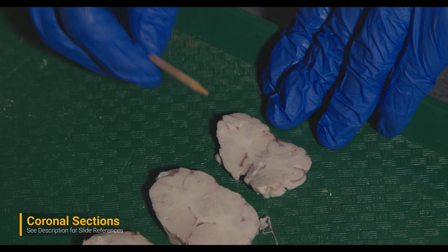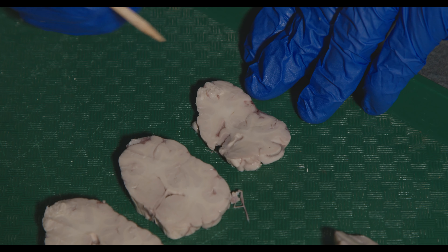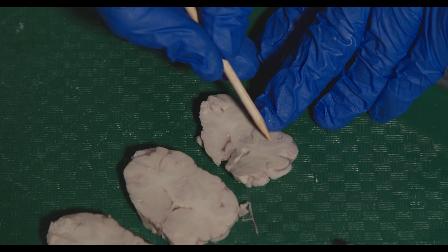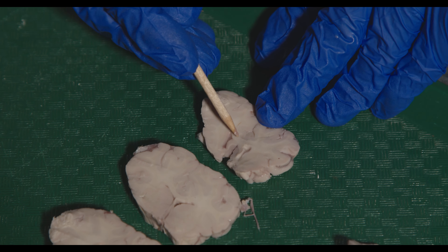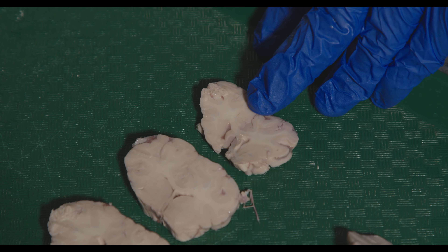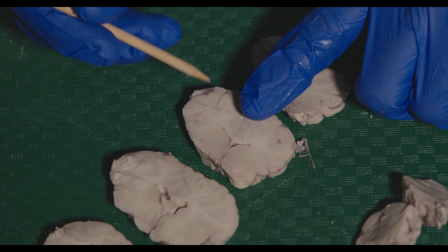The cuts are laid out from anterior-most to posterior-most. Starting with the most rostral section, closest to plate nine in your atlas — here is the corpus callosum. Even unstained, you can see the white matter crossing between the two hemispheres. This is the anterior-most portion of the corpus callosum. You can also start to see the beginnings of the caudate and putamen, though they're more visible slightly further back. On the next section we can see the corpus callosum again and some of the septal nuclei, though those aren't critical for our purposes.